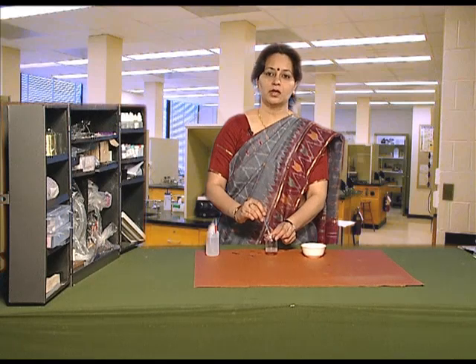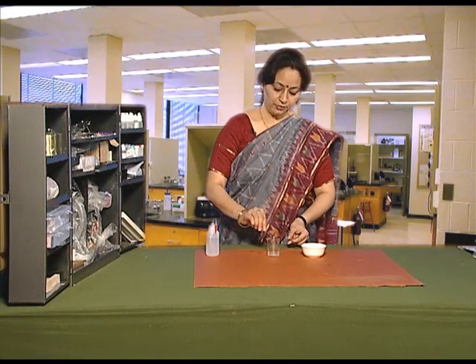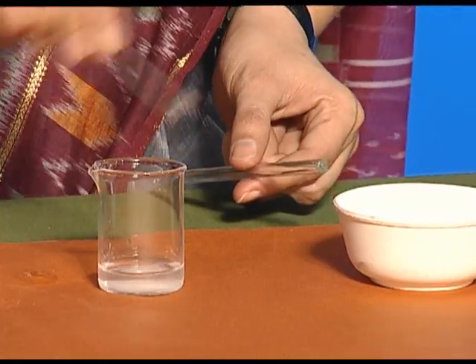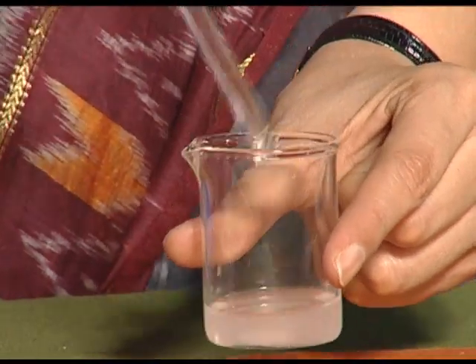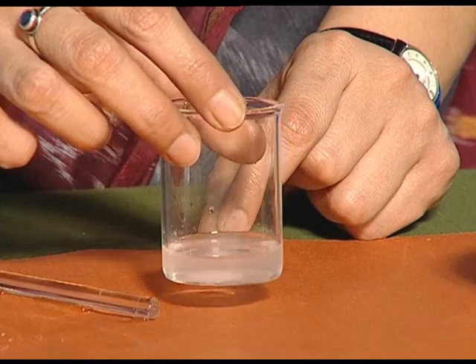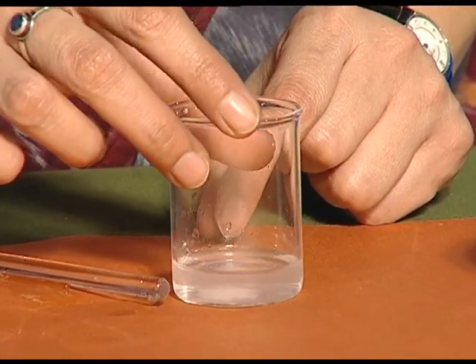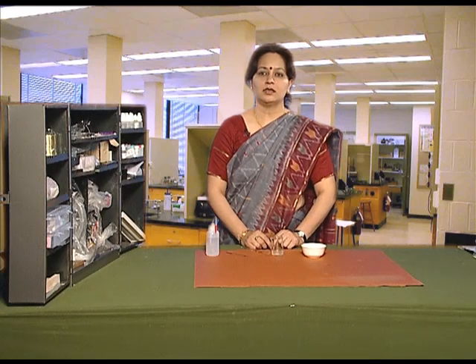Go on adding more spatulas of salt with constant stirring till the salt completely disappears. You can see that it has formed a clear solution and we can no longer see the salt. Add more common salt and stir it. Now you can see that some of the salt remains at the bottom of the beaker and no longer dissolves in water. It means that in this known volume of water, it contains the maximum amount of salt. Such a solution, which contains the maximum amount of solute in a given amount of solvent, is known as a saturated solution.